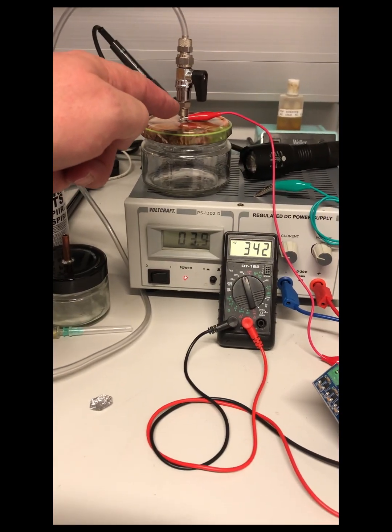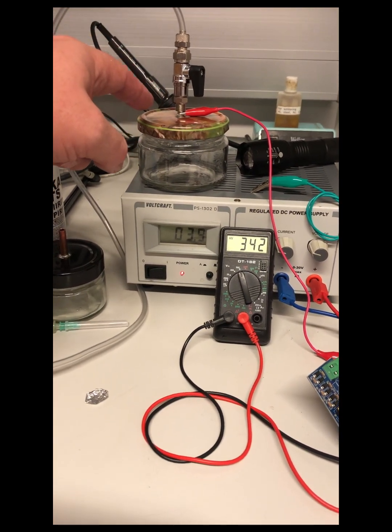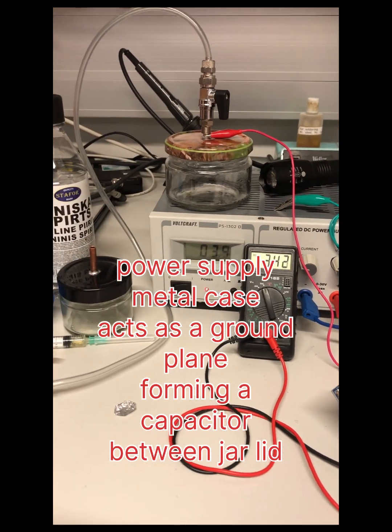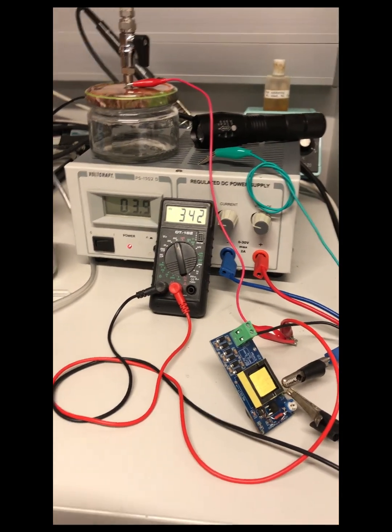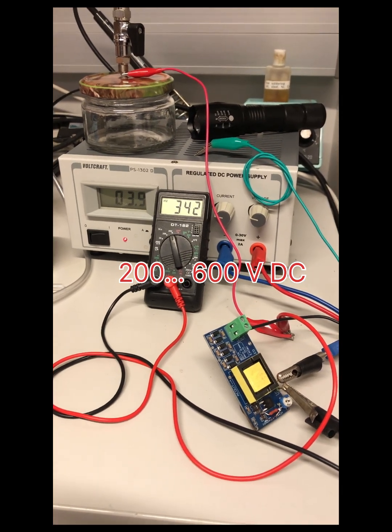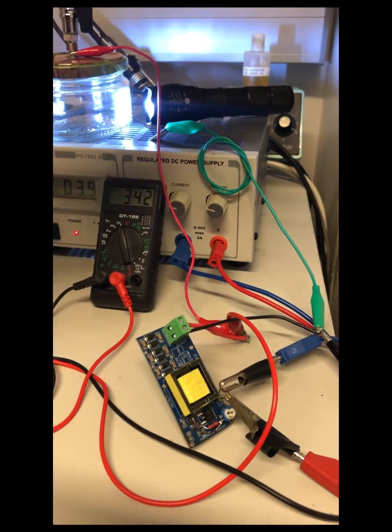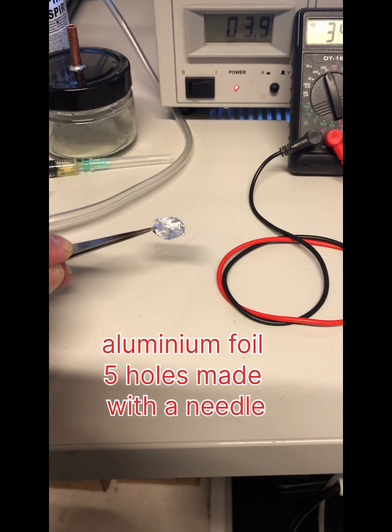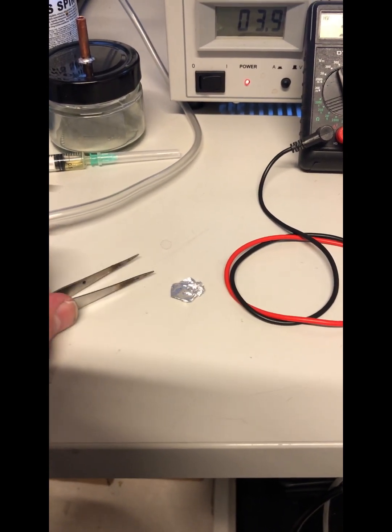To the lid of the jar we have a copper pipe soldered in the hole and high voltage applied between the cover and ground. The high voltage is sent from a cheap DC-DC converter from AliExpress and is about 300 volts, and the light source is the torch. Here is the copper pipe soldered to the lid. It was not necessary to use aluminum foil with perforated holes in front of the source.